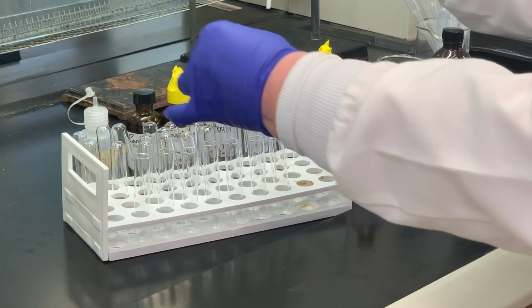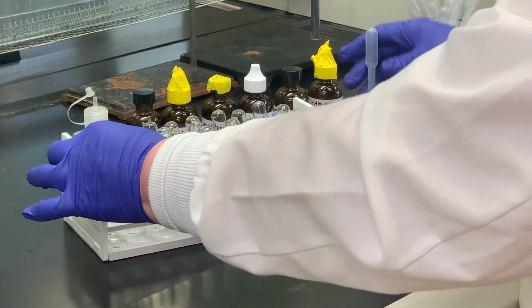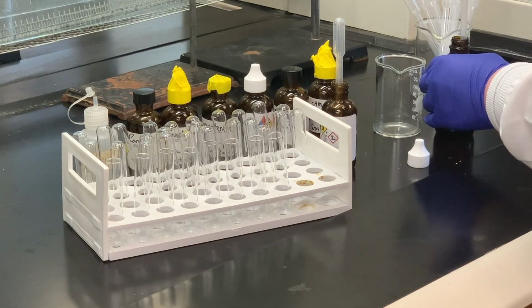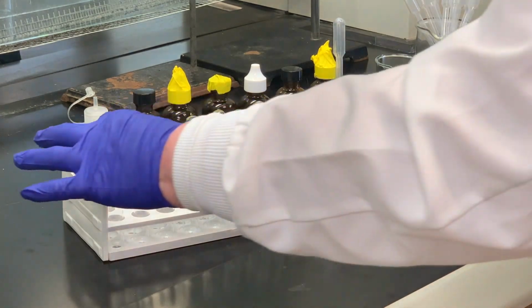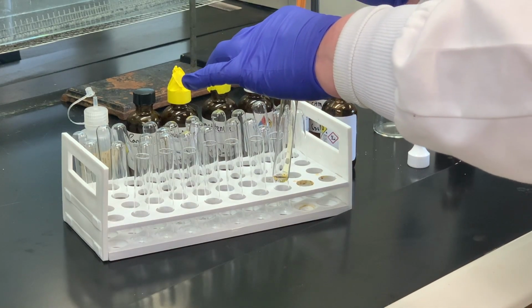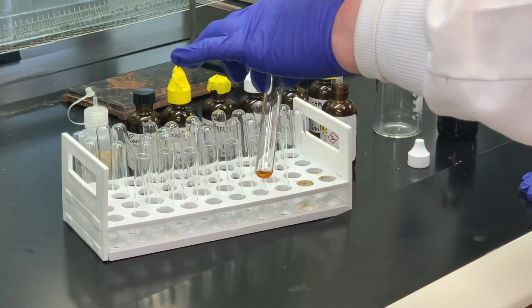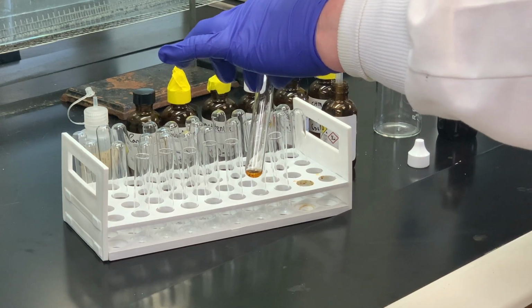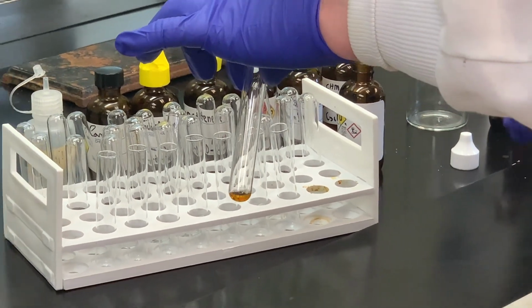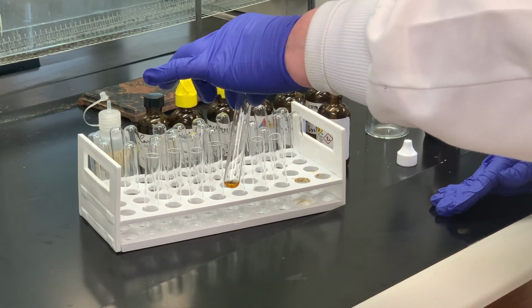So first test tube, I'm just going to put several drops of the cyclohexane, and then I'm going to add a few drops of bromine to that test tube. So here's your cyclohexane. I'm going to add some bromine to it, a couple of drops of bromine. And if you notice, the orange color stays. So if the orange color stays, there was no reaction. And remember, bromine for this particular experiment is only going to react with carbon-carbon double bonds that are unsaturated, excluding those of aromatic compounds such as benzene.